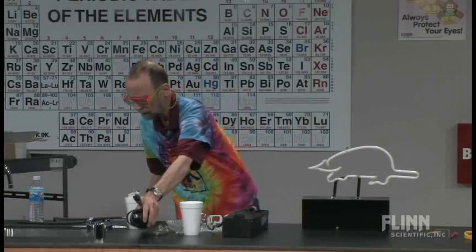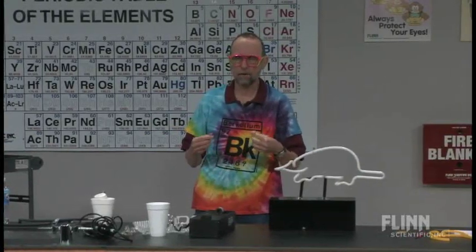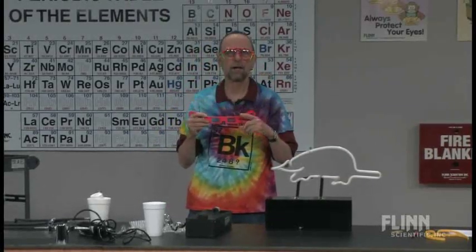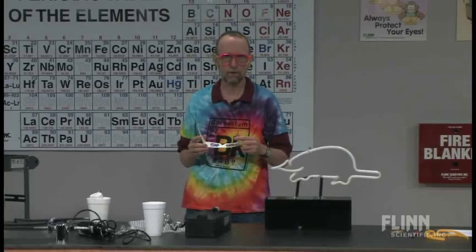In summary, we've taken a look at the spectral lines, which are a fingerprint or an ID for each particular element, and you're able to look at these with the diffraction glasses. In a week I'd like you to bring that lab data back, and I'm going to give you one of these elements as an unknown, and you will have to identify it based upon the information you've copied down.